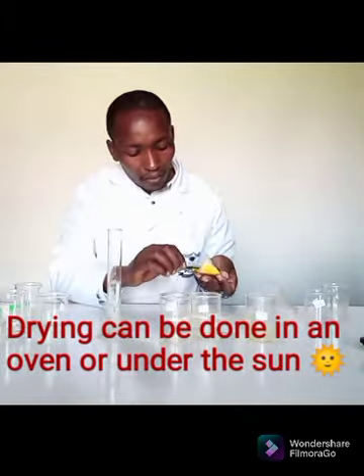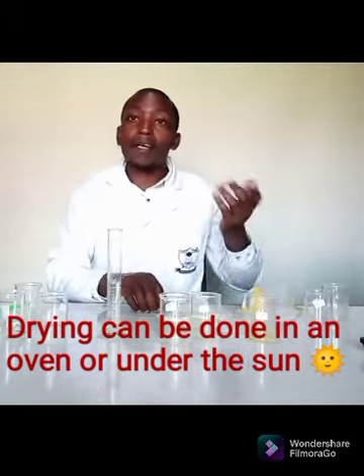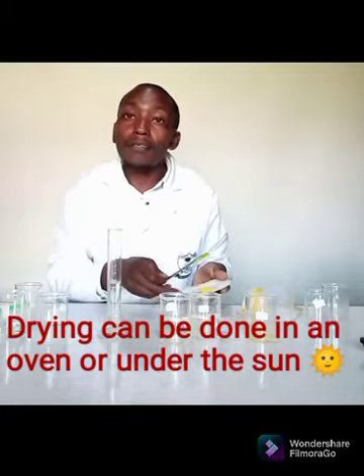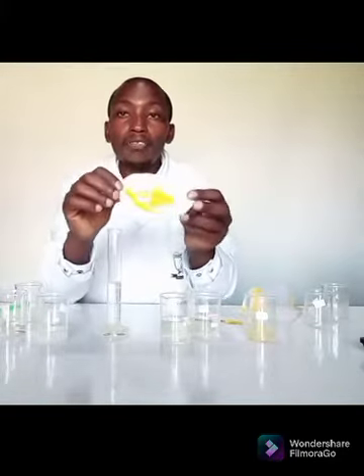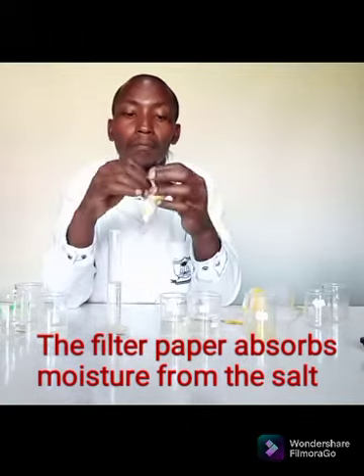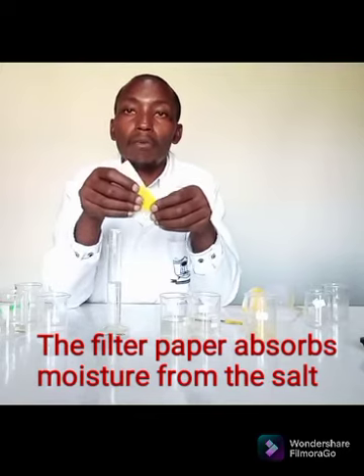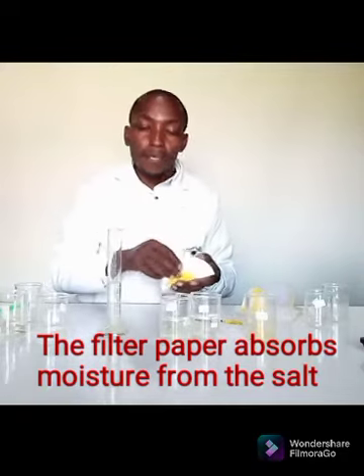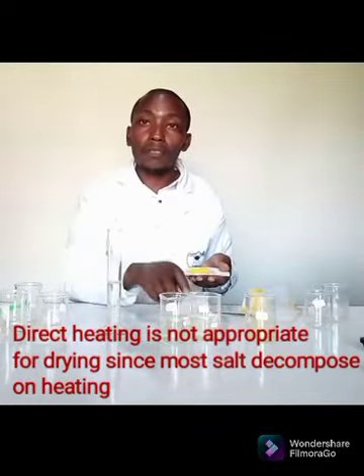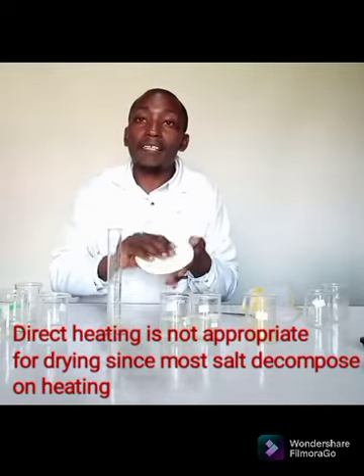Remember, I can as well dry it in an oven, if I have an oven. I can as well dry it under the sun, if I am in a sunny day. So I need to place it on a filter paper, then I fold. The filter paper will absorb the moisture, and eventually the salt that I've prepared will be very dry. This method of drying the precipitate is very applicable for salts that can easily decompose when heated. So I'm not supposed to do a direct heating.